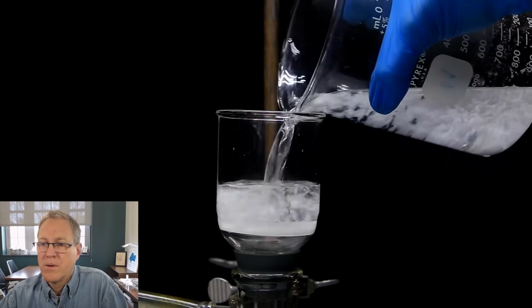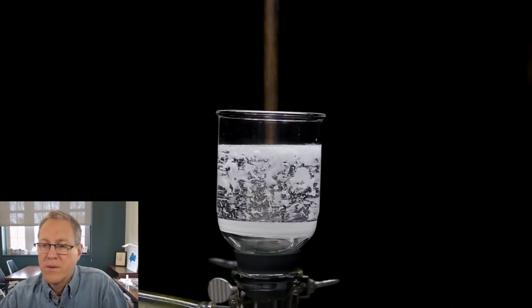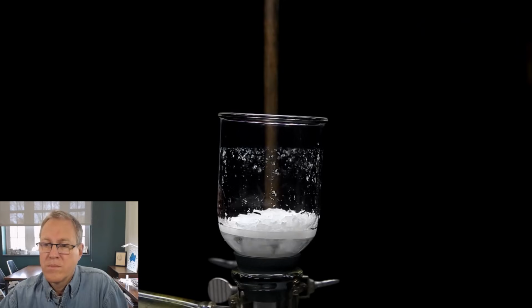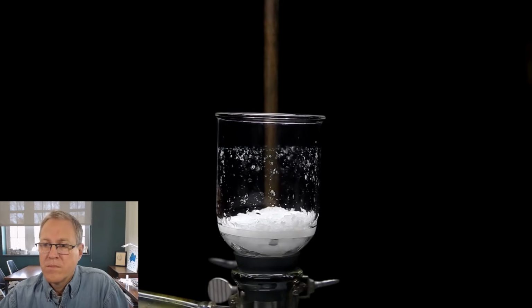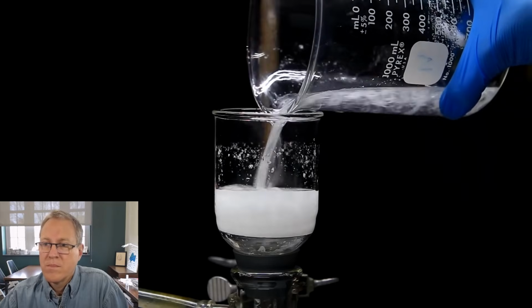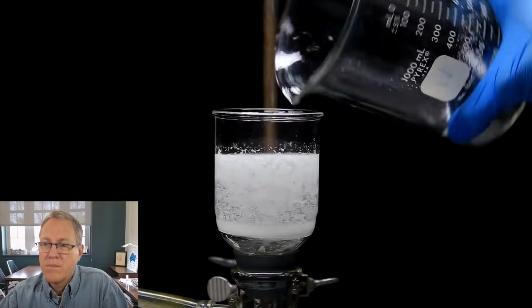These crystals are then separated from the water by transferring them to a nice clean fritted filter. The water is vacuum filtered off, and just like before, we wash the crystals a few times with water. Each of the water washings is also used to wash out the beaker to make sure that none of the lidocaine stays behind in it.